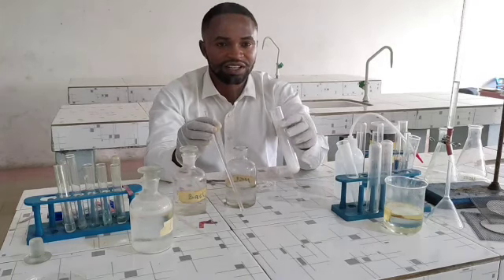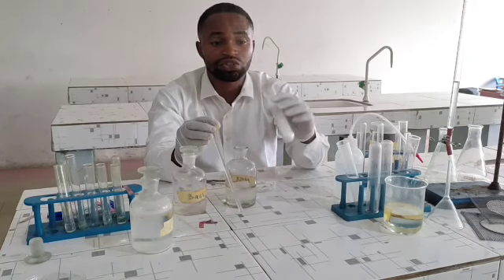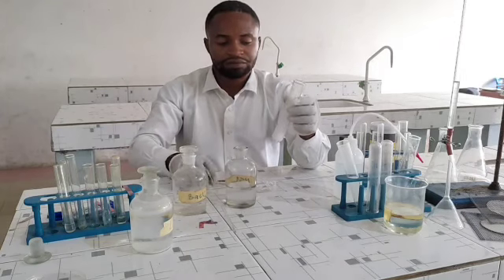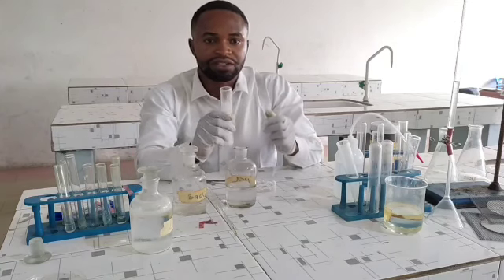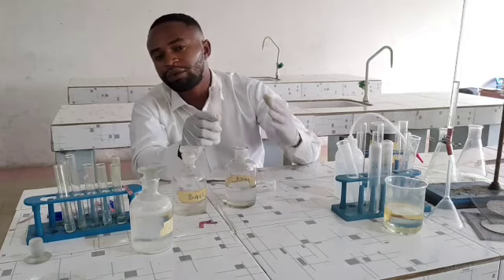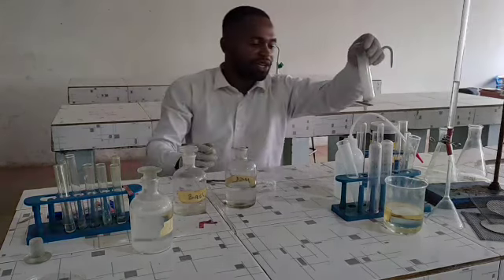It has a choking smell. I can actually perceive the smell. It has a choking smell, and that gas is ammonia. Now, at the end of the day, what is going to be your inference? Ammonia from the ammonium ion is present.